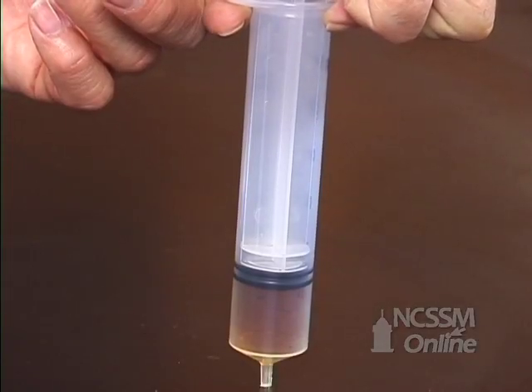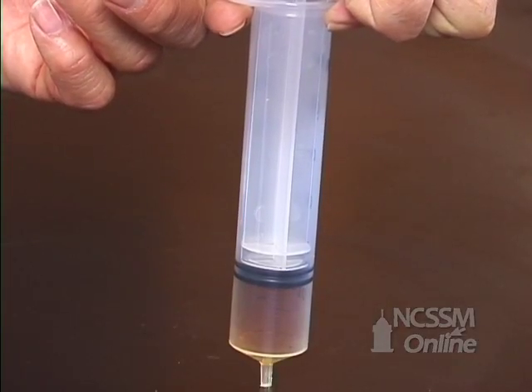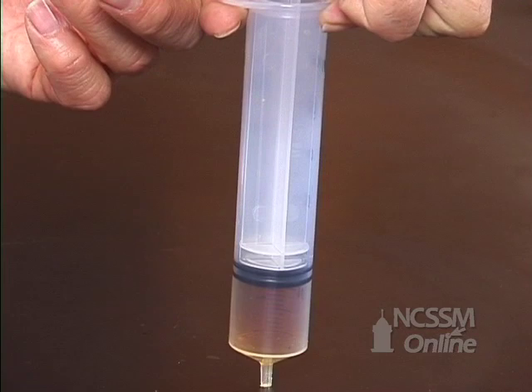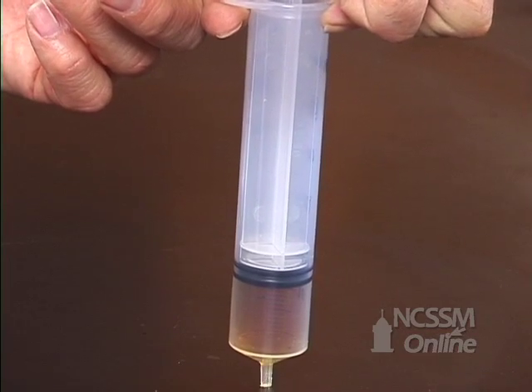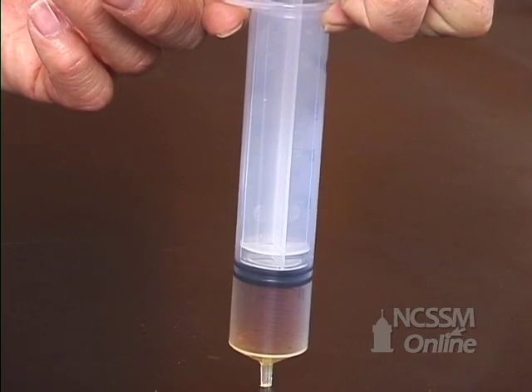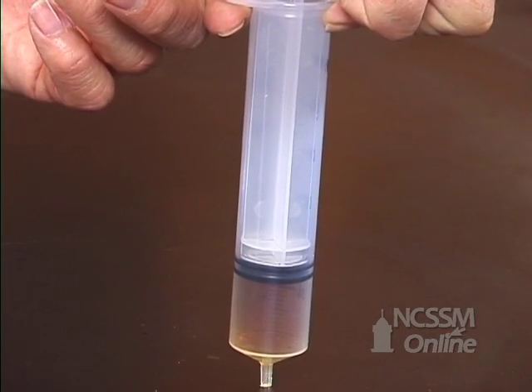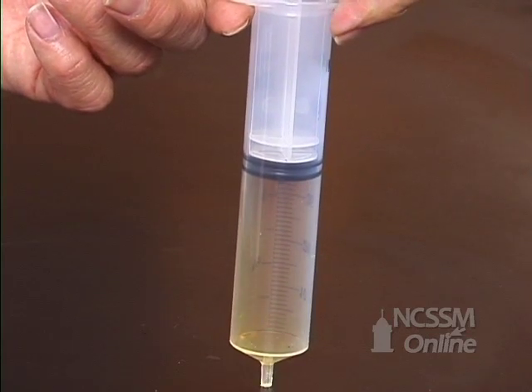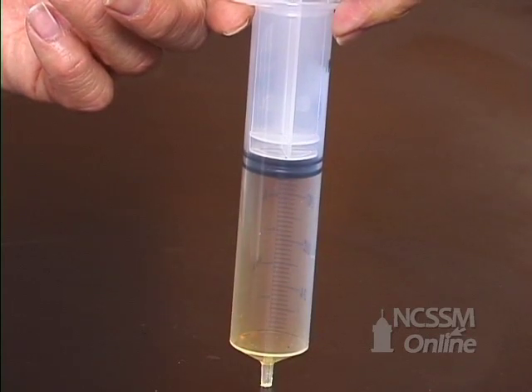We have a mixture of NO2 gas and N2O4 gas compressed in a syringe. We're going to expand the gas quickly. The color initially gets lighter due to the decrease in concentration.